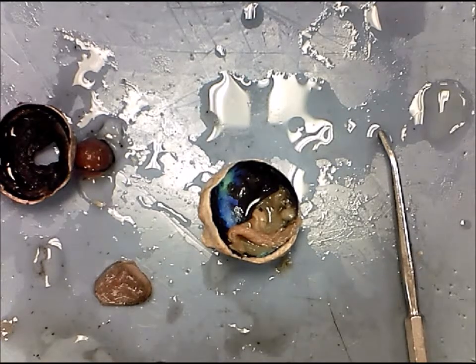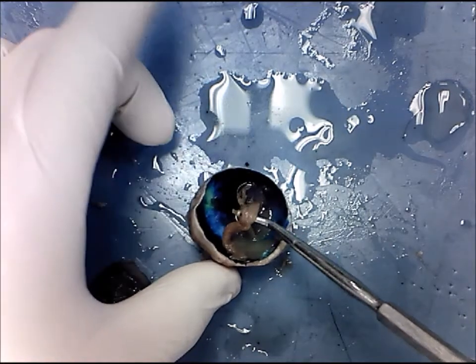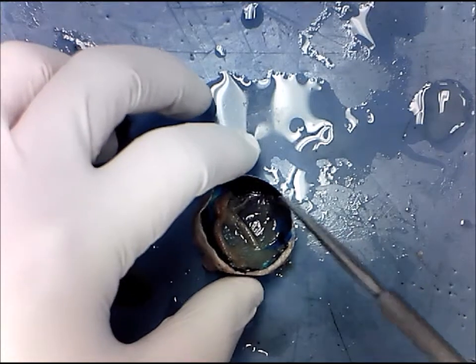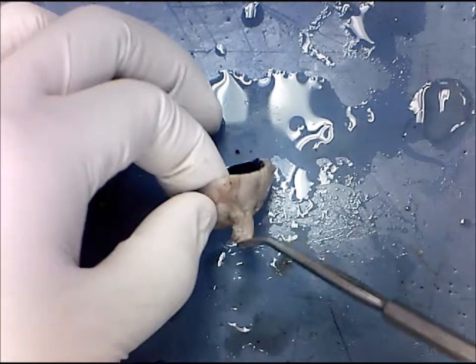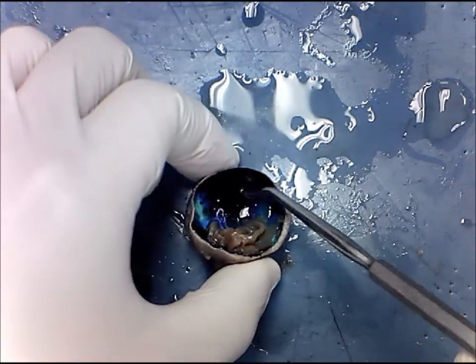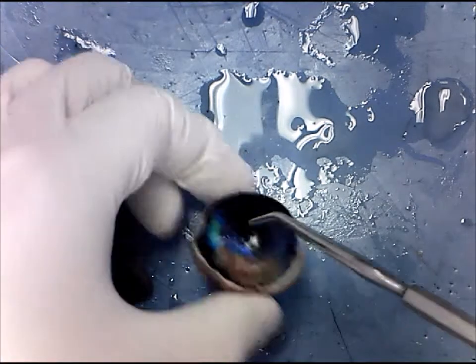Looking at the posterior half of the sheep eye, there are structures you have to be able to identify. This brown material here is the retina. The retina houses rods and cones — special types of neurons that help sense vision. The axons of rods and cones converge and exit the eye through the optic nerve. Below the retina is this black structure called the choroid, and underneath the choroid is the sclera.